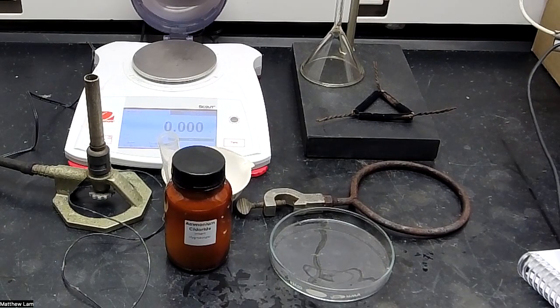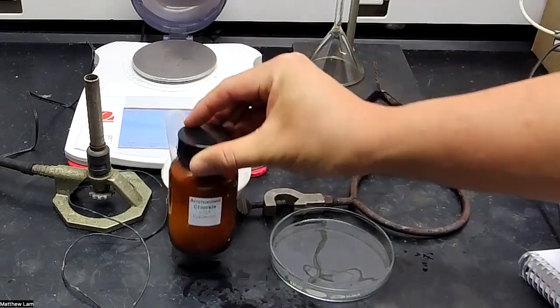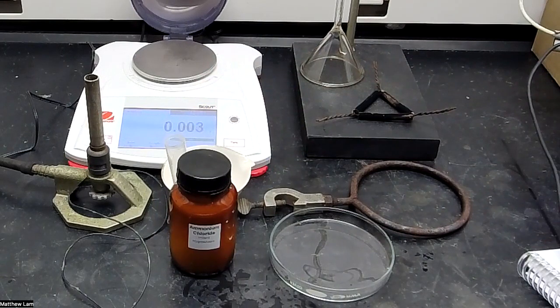We're going to see a compound, in this case ammonium chloride, sublime from a solid to a gas.